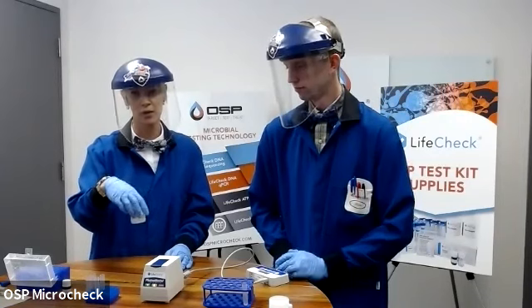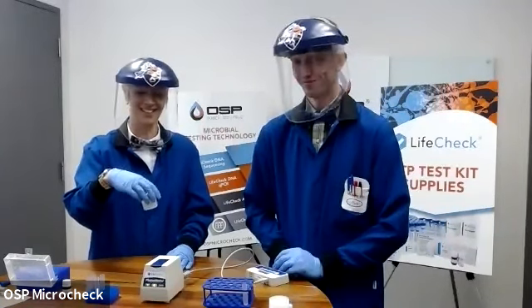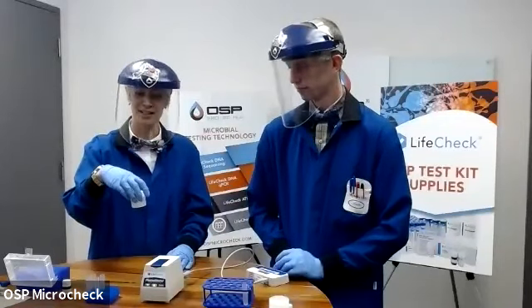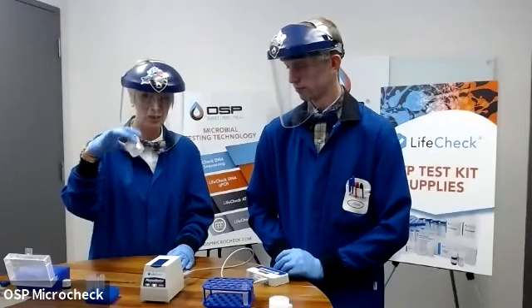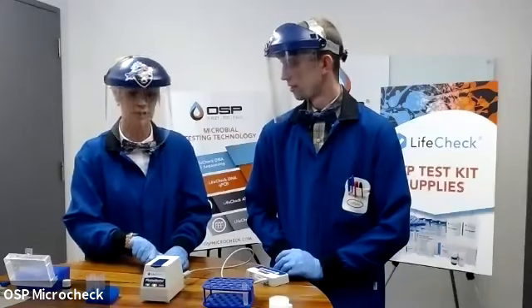It's easier to pour that tube into the field container than to go the other direction. Suggest that you sample it as you go along, make sure you don't lose count of who's who in these little containers. And then we can start taking our reading.